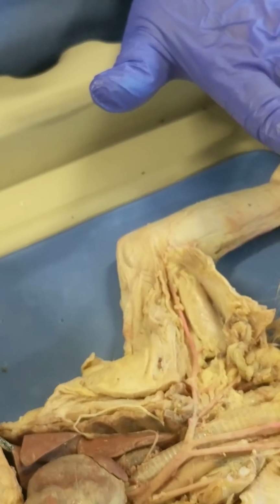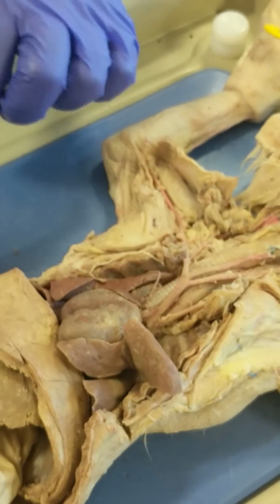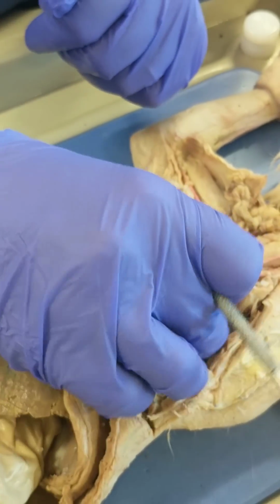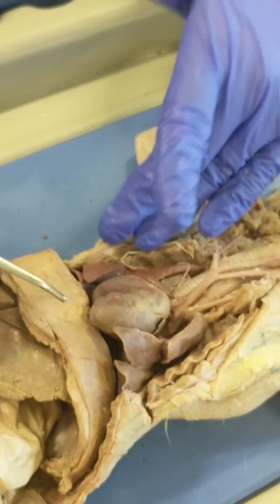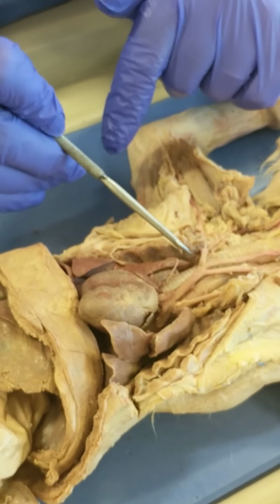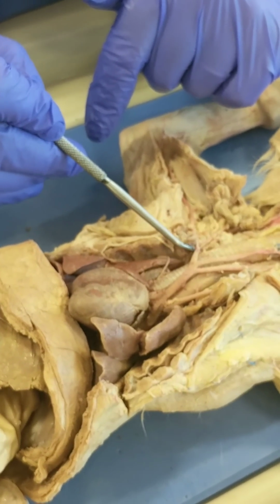I think that's all the arteries you have to know up in this region, but there's a few associated with the heart. So now we're going to go down to the thoracic cavity. Note that in this cat, I cut away the sternum and most of the ventral rib cage. So you can't see the internal mammary artery that would branch off of the subclavians. Here's a breaking point right there.